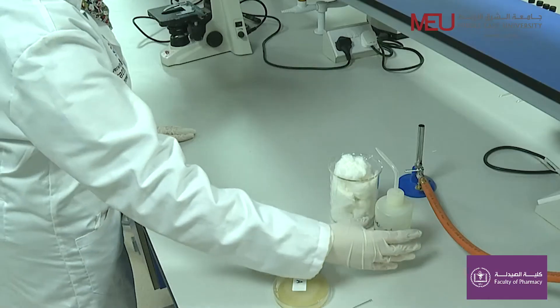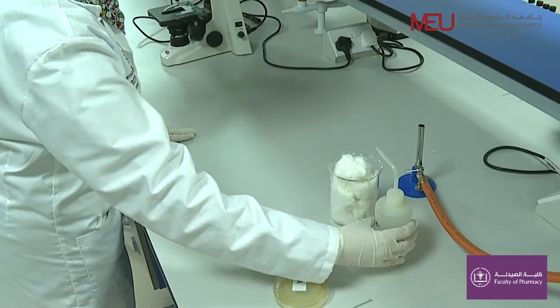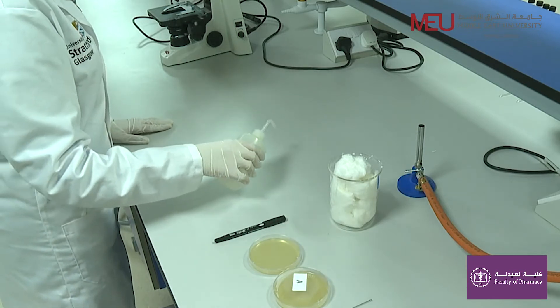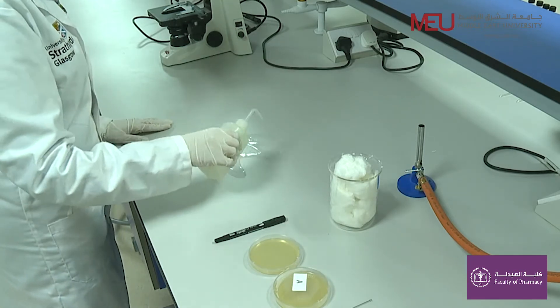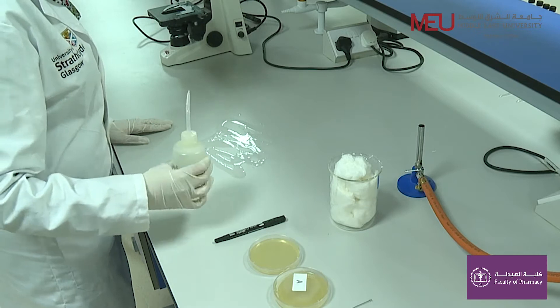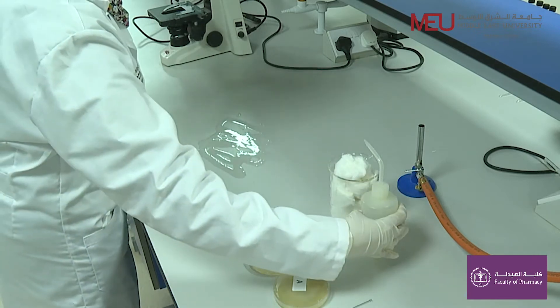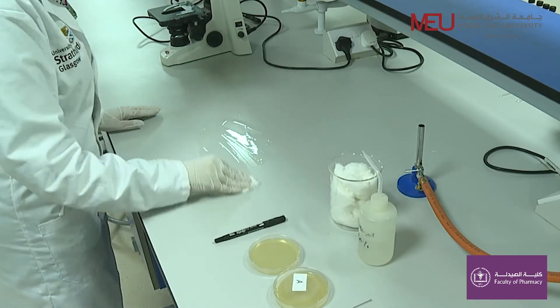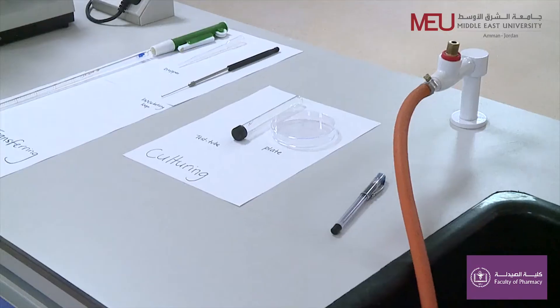At the beginning and at the end of each lab, wipe your bench tops with a disinfectant solution provided by the instructor, which is alcohol 70%.